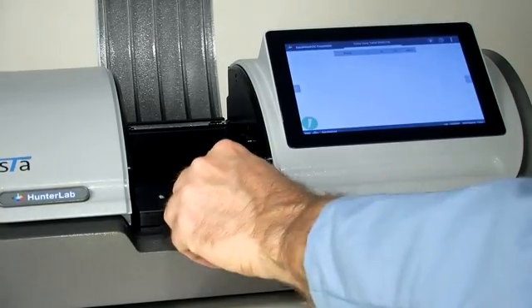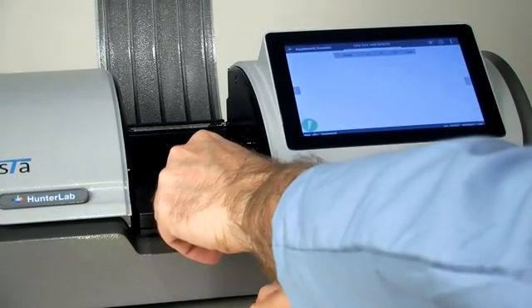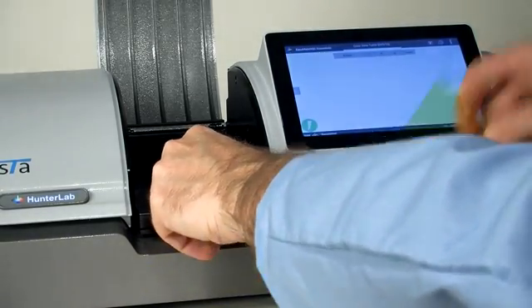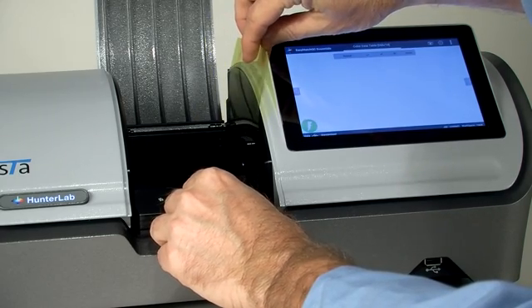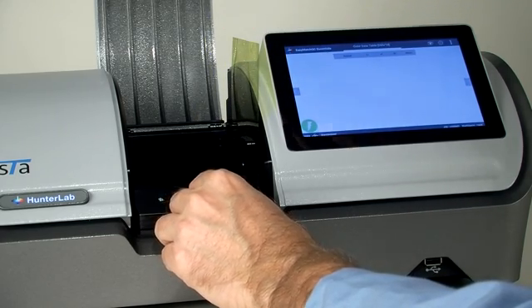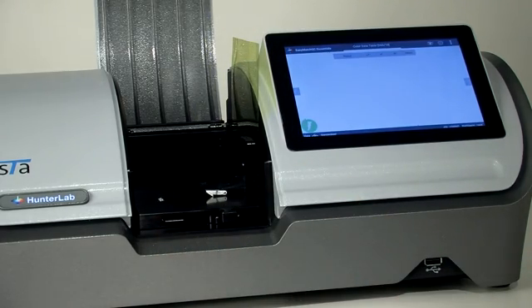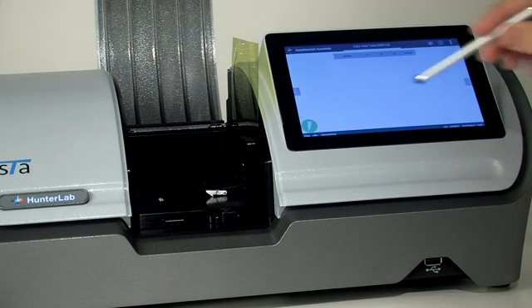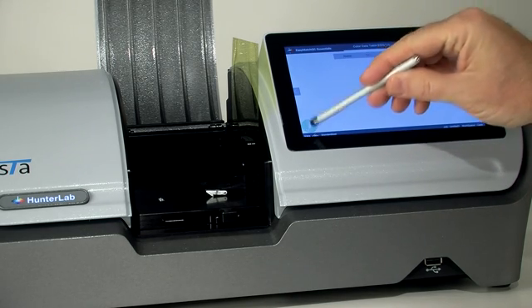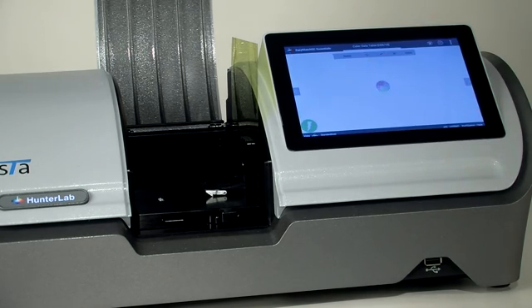Pull back slightly on the spring-loaded lever and place your sample against the wall. Release the handle. Press the measure button to begin the measurement process.